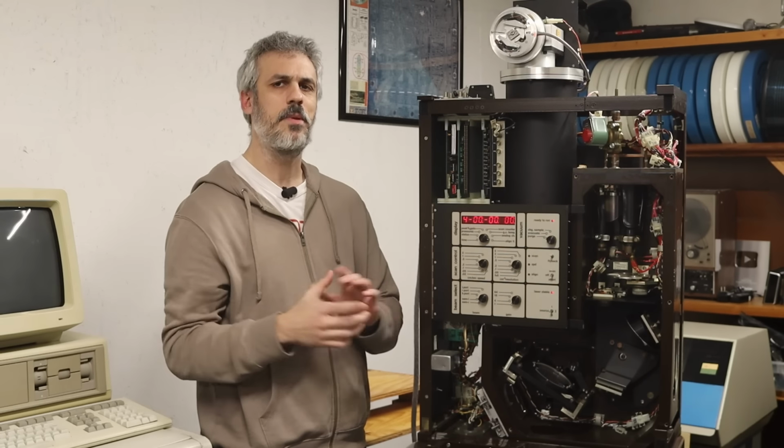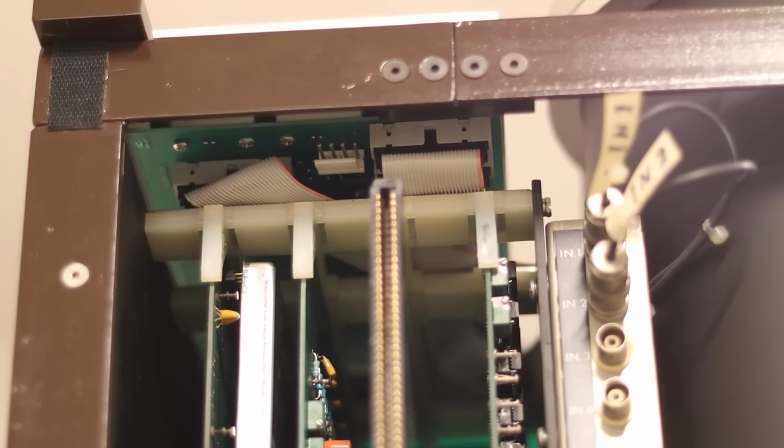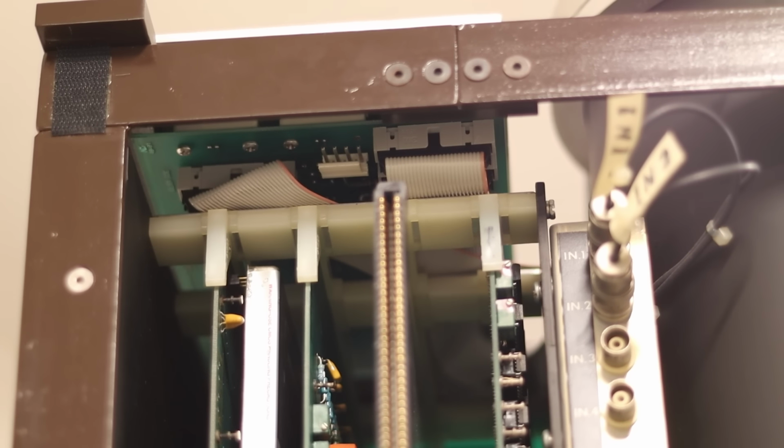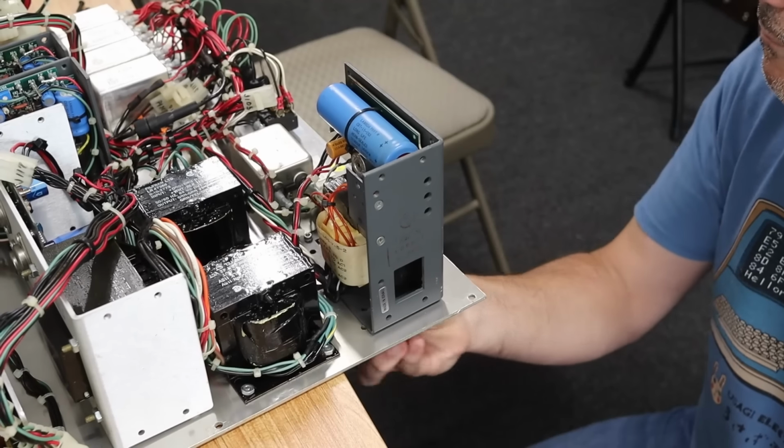However, the bigger problem that we think we have is that right up here is the opto-isolator board for the Bomem itself. It seems that this is the upgraded opto-isolator board, which has a little power plug right on the front here. And that power plug is not plugged in, which means no communication ever makes it past here.